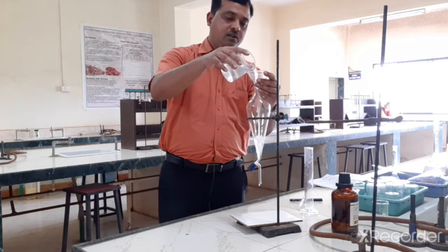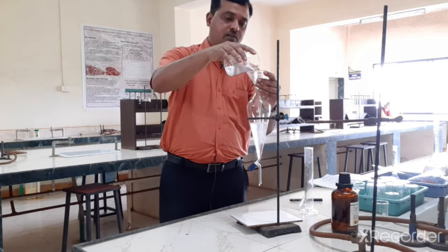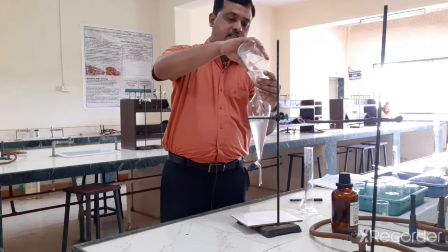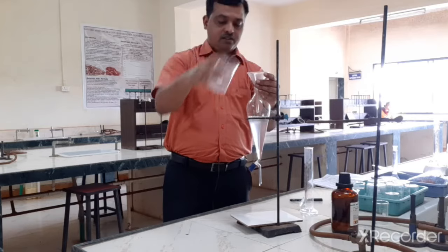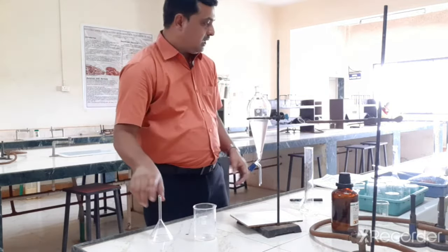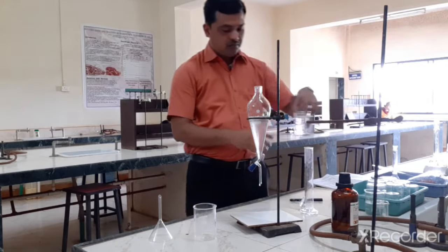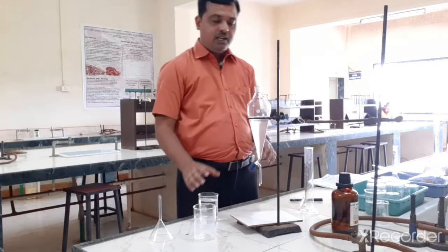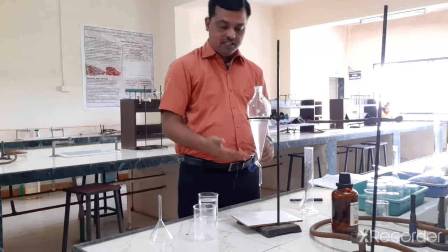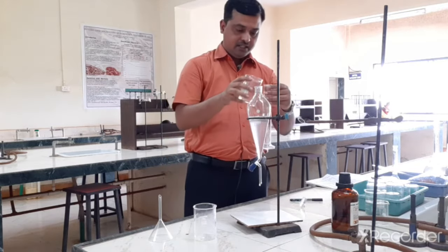So we are going to now extract this trimethoprim from chloroform with the help of aqueous acidic solution. Okay, so we have 1 molar acetic acid. Now we have to extract the trimethoprim by ionization with the separating funnel with this 1 molar acetic acid solution.